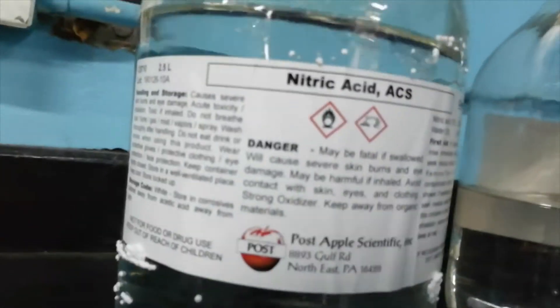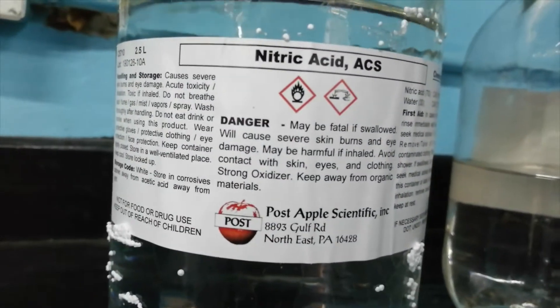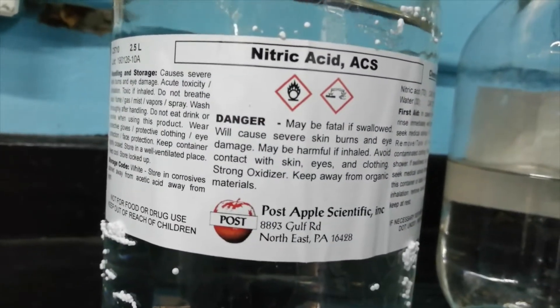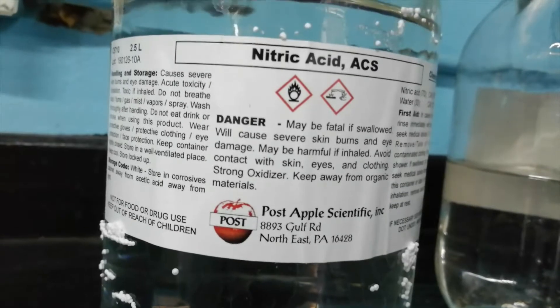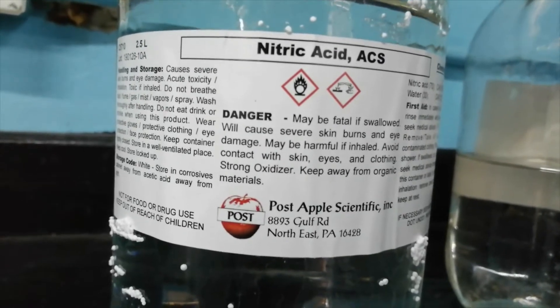Right here we have nitric acid. It's a monoprotic acid, so it releases one hydrogen ion in solution, and nitric acid dissolves everything.